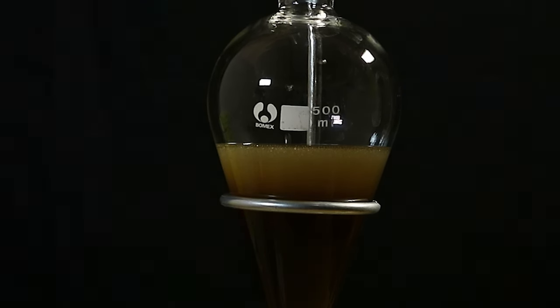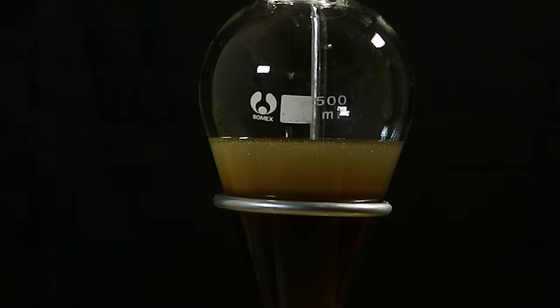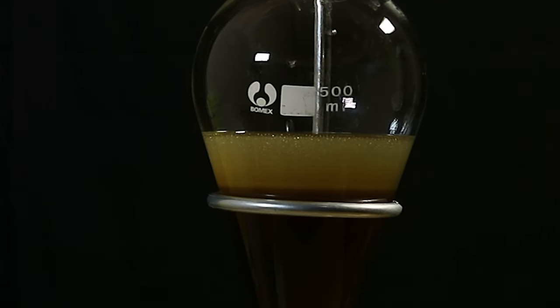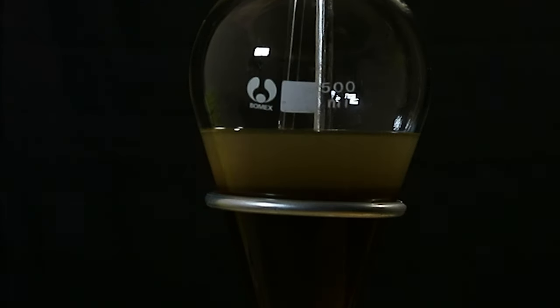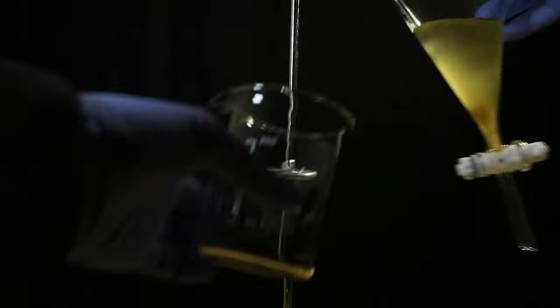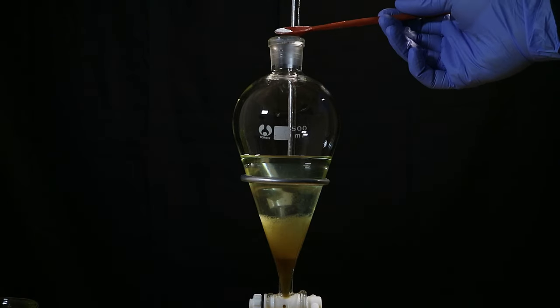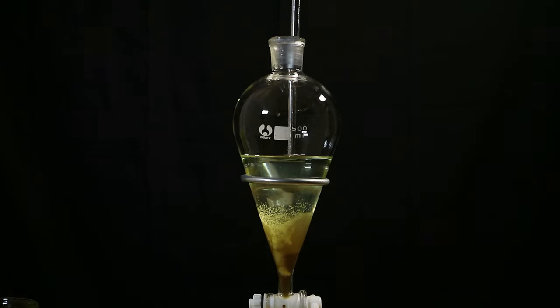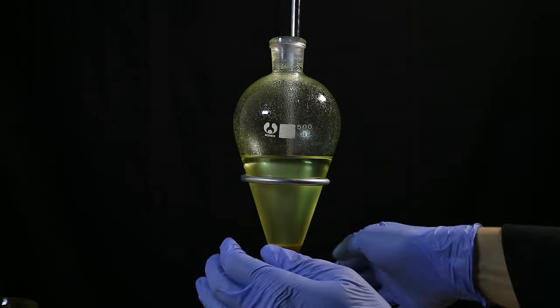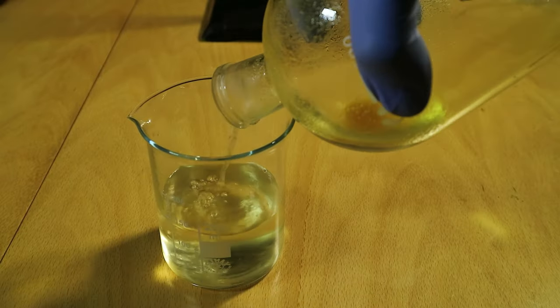Normally this situation can be resolved by just pouring soda bicarbonate into the funnel, which would break the emulsion while also neutralizing any carboxylic acids in the solution. But in this case, we are going to attempt to reabsorb this coffee soup back into the beans, so I want to avoid altering its composition as best I can. That's why I carefully drained the aqueous phase from the bottom and the ethyl acetate from the top and repeated the process three times. In the last wash though, I left a little bit of the aqueous phase in the funnel together with the emulsified layer and added a bit of soda bicarbonate. After shaking, you can see the layers separate much more clearly and very fast. I could then drain the rest of the bottom phase and discard it, leaving me with a much purer top phase that I can now try and recrystallize caffeine from.